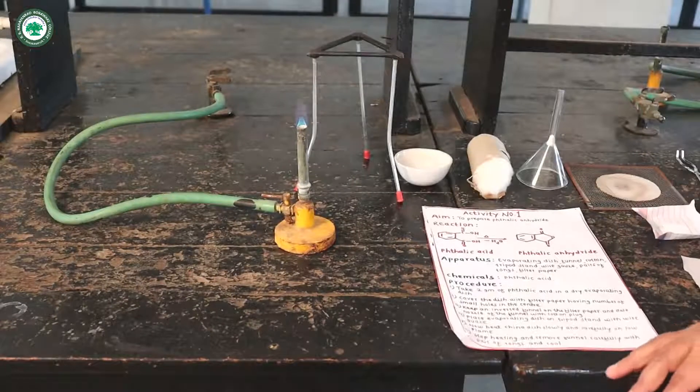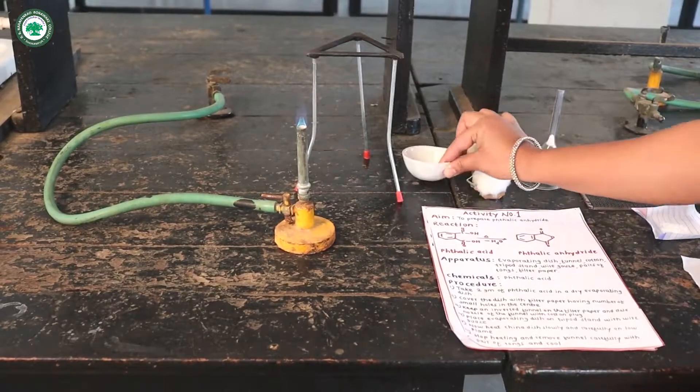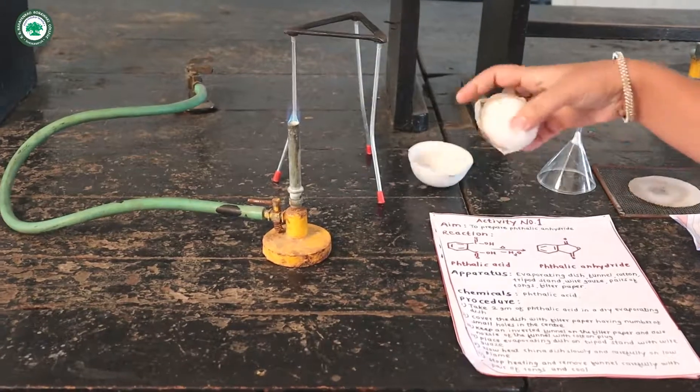Apparatus required for this experiment: evaporating dish, tripod stand, cotton.